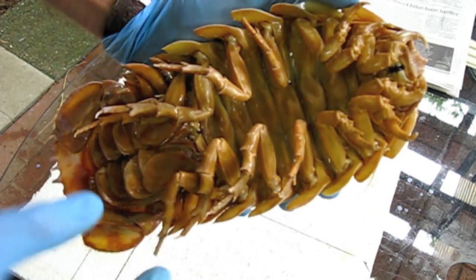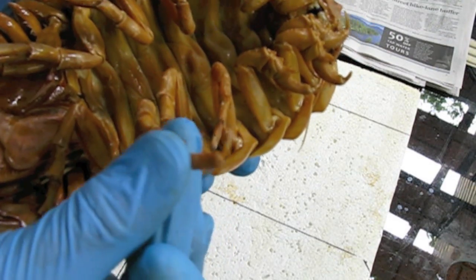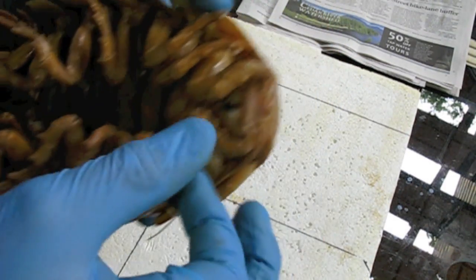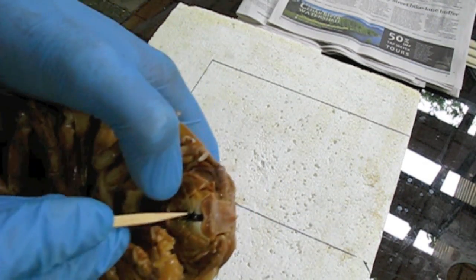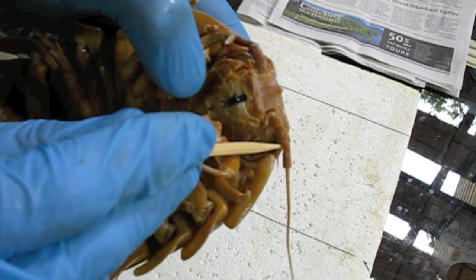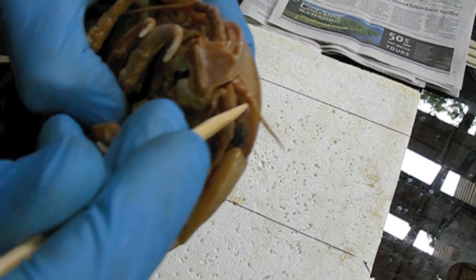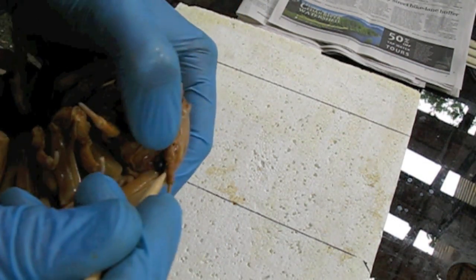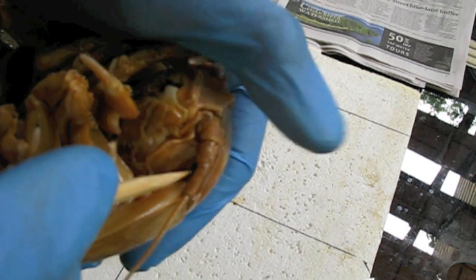I've got most of the alcohol drained out. You can see that the legs have a very sharp claw on the end. Up here in the head, the mouth is located right here. This little jaw is here. It's got a large antenna, and above that, a small antenna. And then these are the eyes, here, behind the antennas — kind of look like sunglasses.